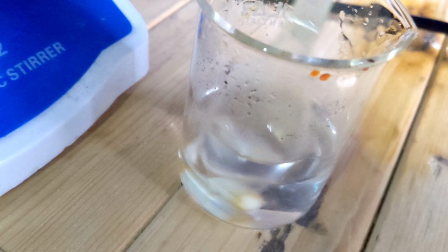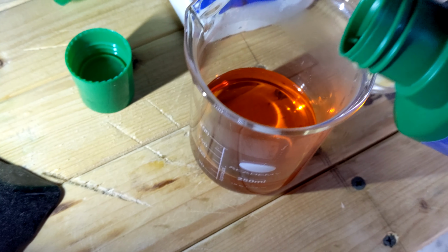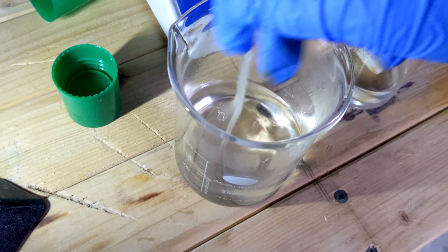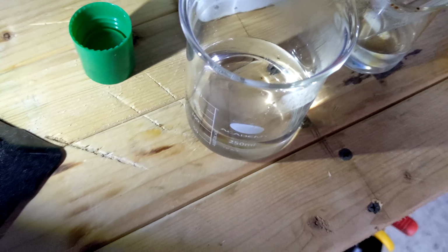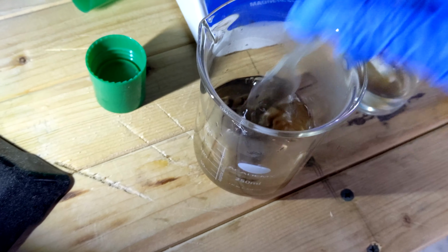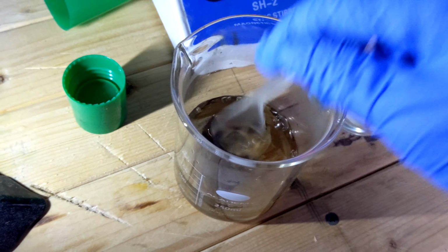You see, I'm a little pleasantly surprised at how well that worked. Now, if you don't have this stuff, you can use metabisulfite. But I didn't have any, and I had this aquarium stuff, so I used that instead. And just shove the filter paper in. That destroys any leftover iodine that I couldn't scrape off.